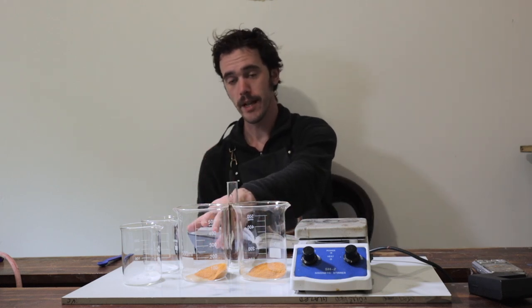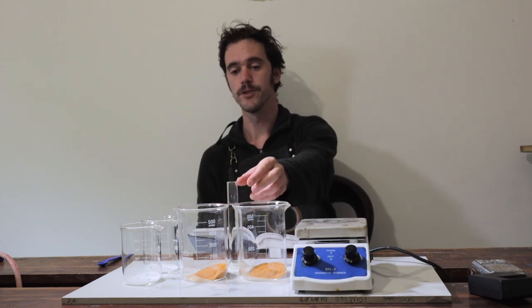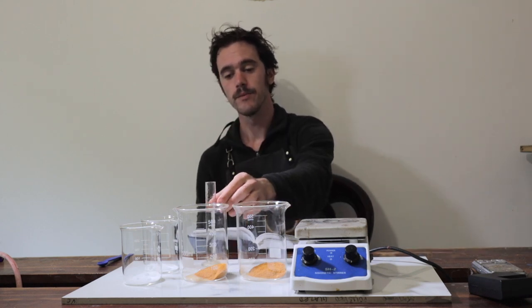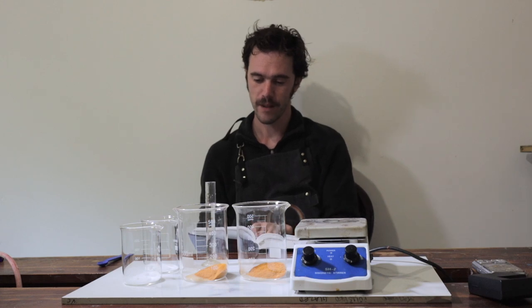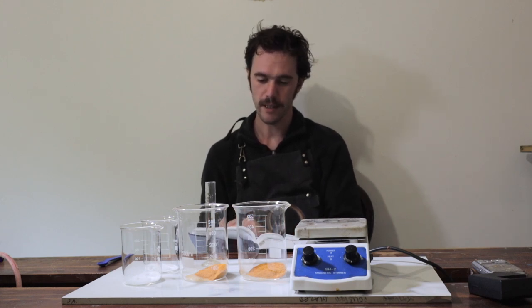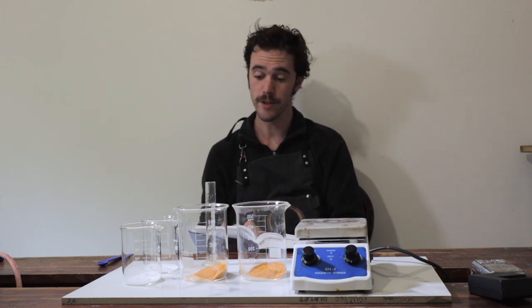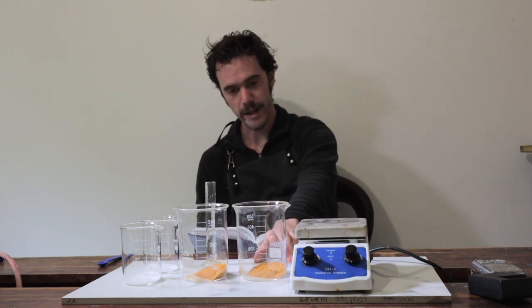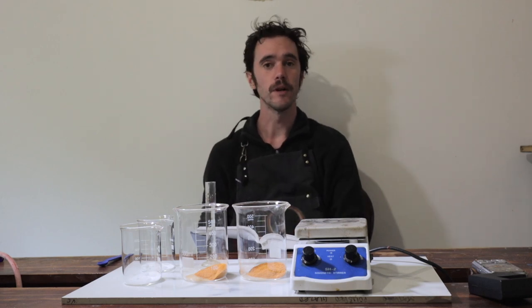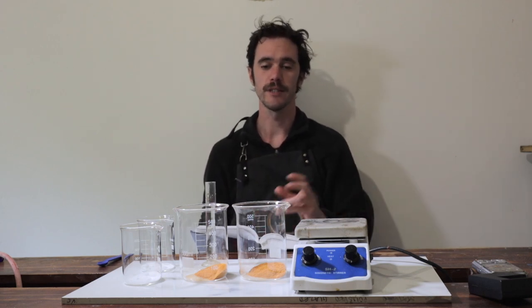I have a second beaker with another 10 grams, which we're going to do with vinegar — our acidified extraction. Birch says experience has shown that brighter colours are obtained this way. He specifies 130 to 150 parts of alum per 100 parts of wood. So because we have 10 grams of Brazil wood, I've measured out 13 grams of alum, and that will be used for our laking extraction process after we've done the water-based extraction.